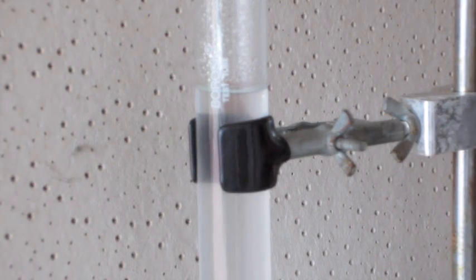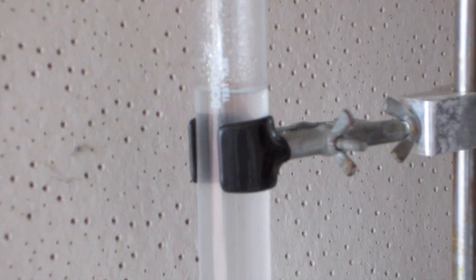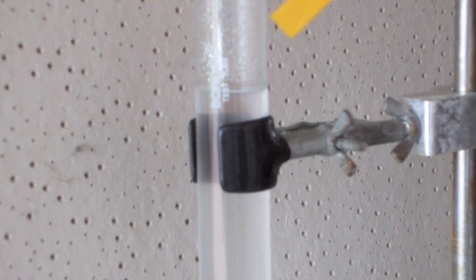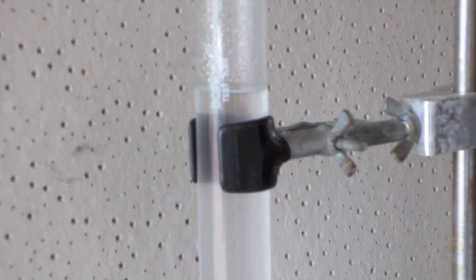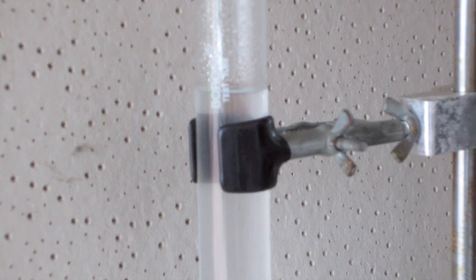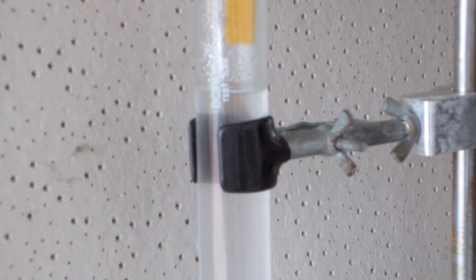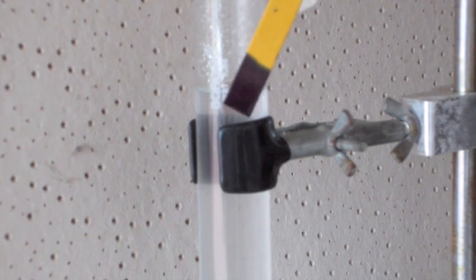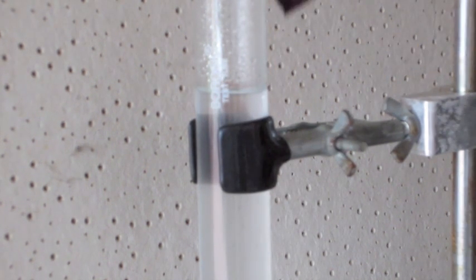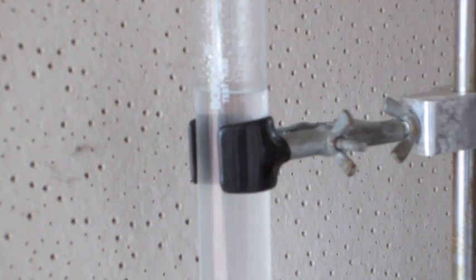If I just took a pH strip and put it into plain water, nothing would happen because water is fairly neutral. Now, because hydroxides are basic, I'm going to test whether the Strontium really reacted. If this turns purple, it did react. There you go — it for sure reacted, and now this water is actually a solution of Strontium hydroxide.